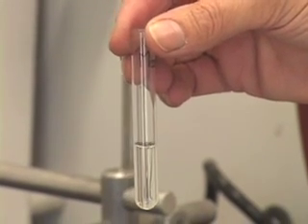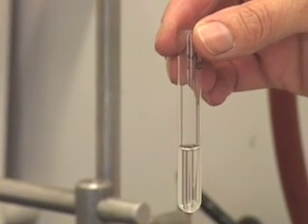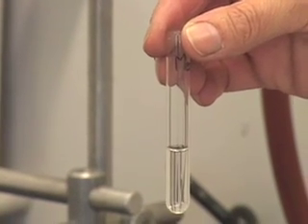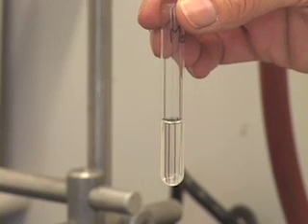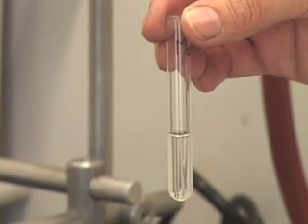Do I have to heat this solution in the steam bath? Obviously not, because it has already dissolved in the room temperature solvent. So, there is no need to heat this solution, and we can eliminate methanol as a suitable solvent.